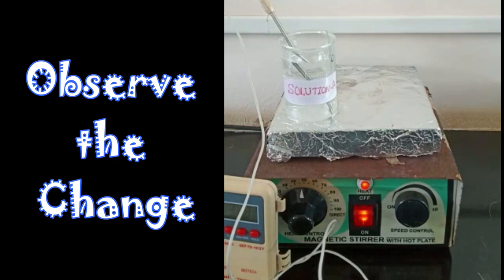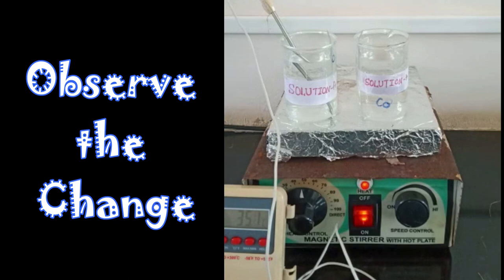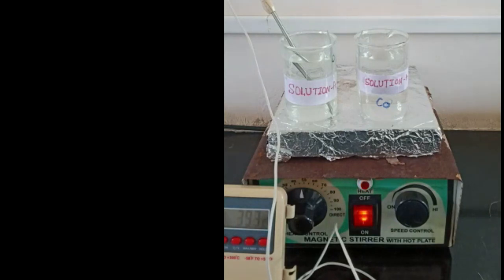We have already studied different parameters which are going to decide the uniformity of thin film. Here we can observe with respect to change in temperature what all changes can happen. The temperature change can be measured using a thermometer.